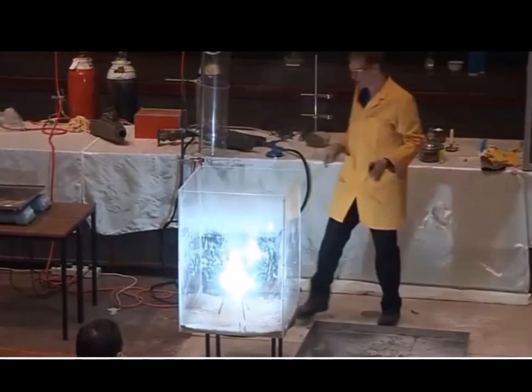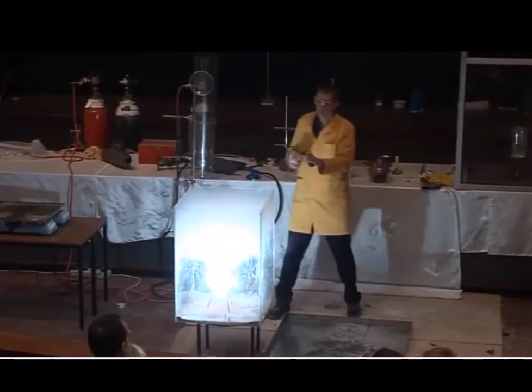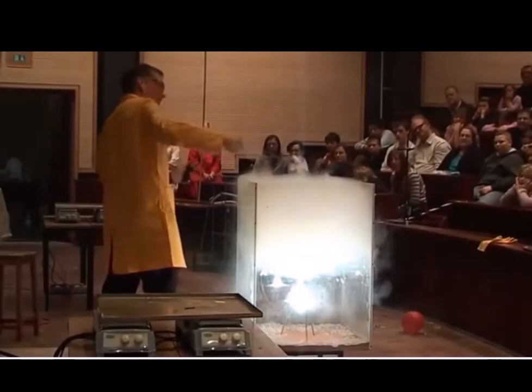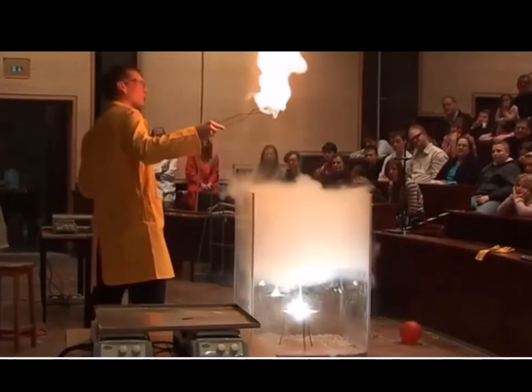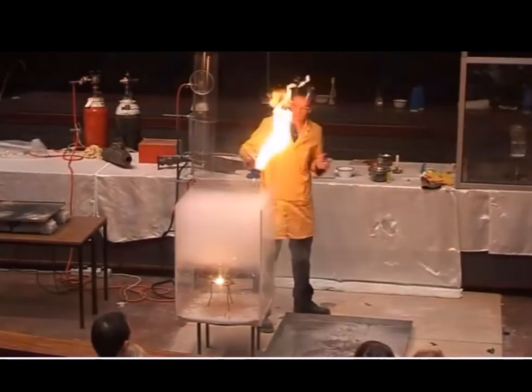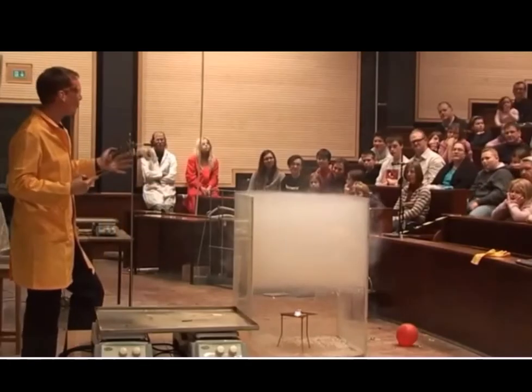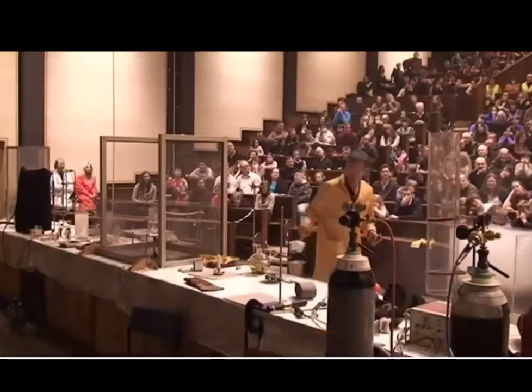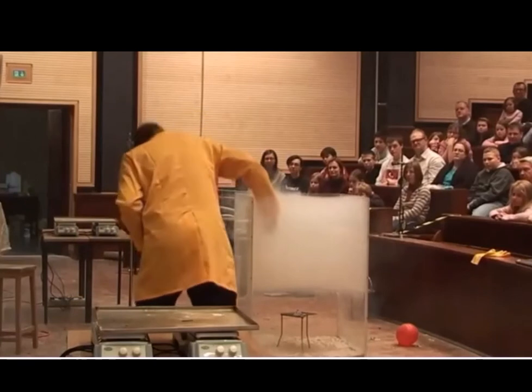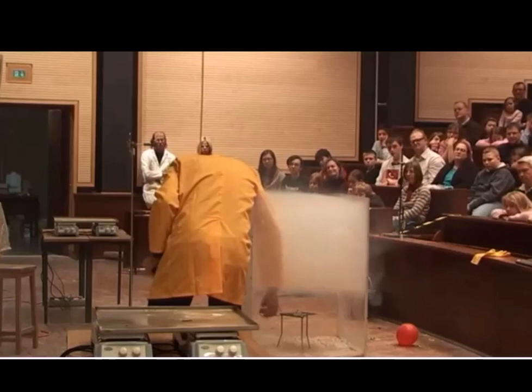And there's the reaction. So again, you'll see that brilliant white light when magnesium reacts. So the main observation is really that brilliant white light, and there he is just demonstrating again that there's still carbon dioxide there. You'll see a lot of white powder. That's the magnesium oxide. So magnesium and carbon dioxide giving us magnesium oxide. And then the other product will be carbon, which is a black solid. So you'll see in a moment he lifts the final reaction mixture out and you'll reveal the black carbon. So magnesium plus carbon dioxide gives us magnesium oxide, that white powder forming a smoke all through that.